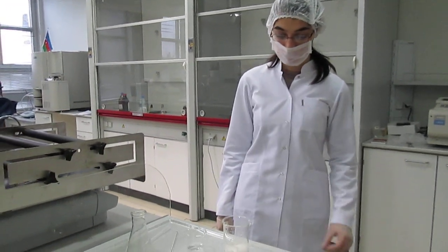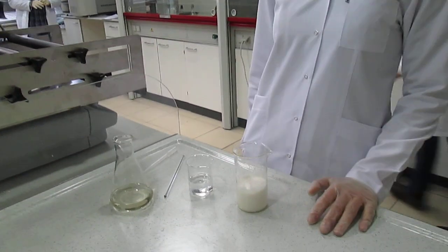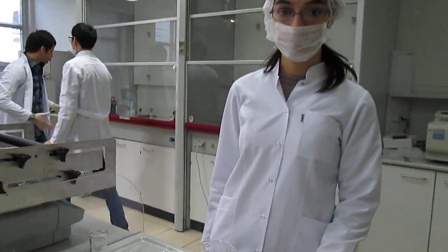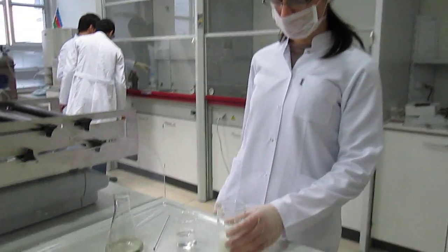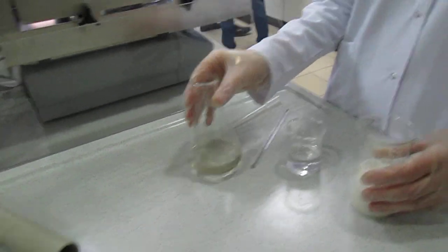Hi teacher, ladies and gentlemen. Today we are going to experience the dehydration of sugar by concentrated acid. For this reaction we need sugar, water, and concentrated acid.